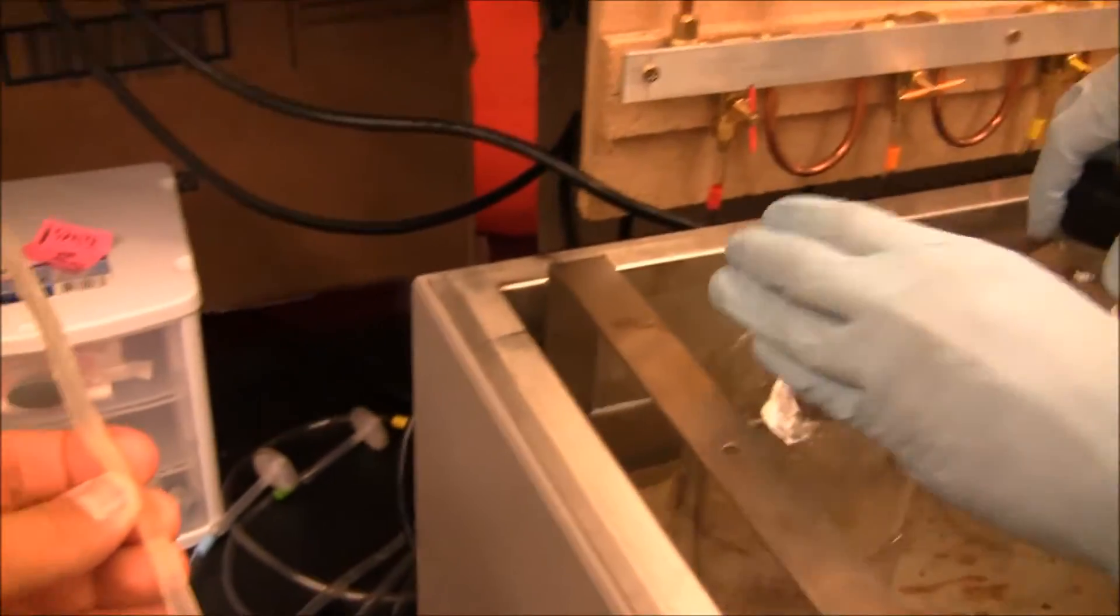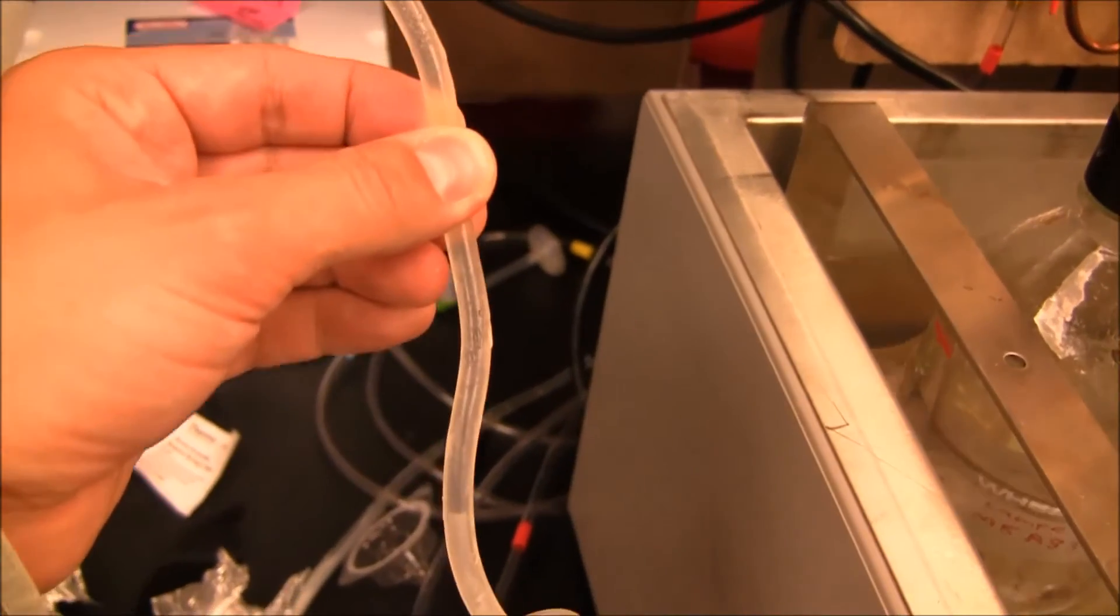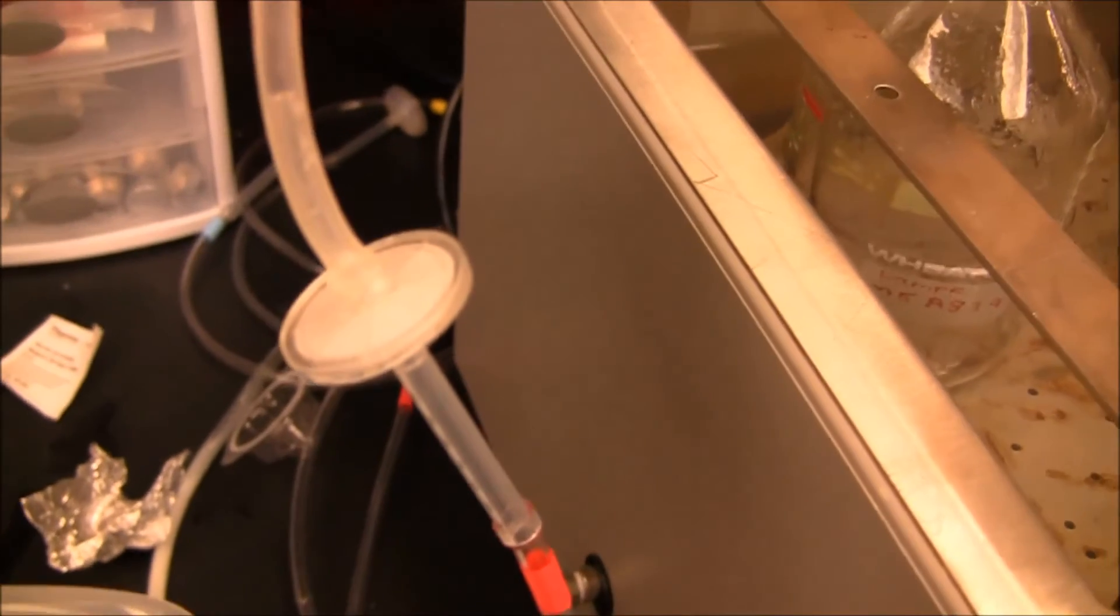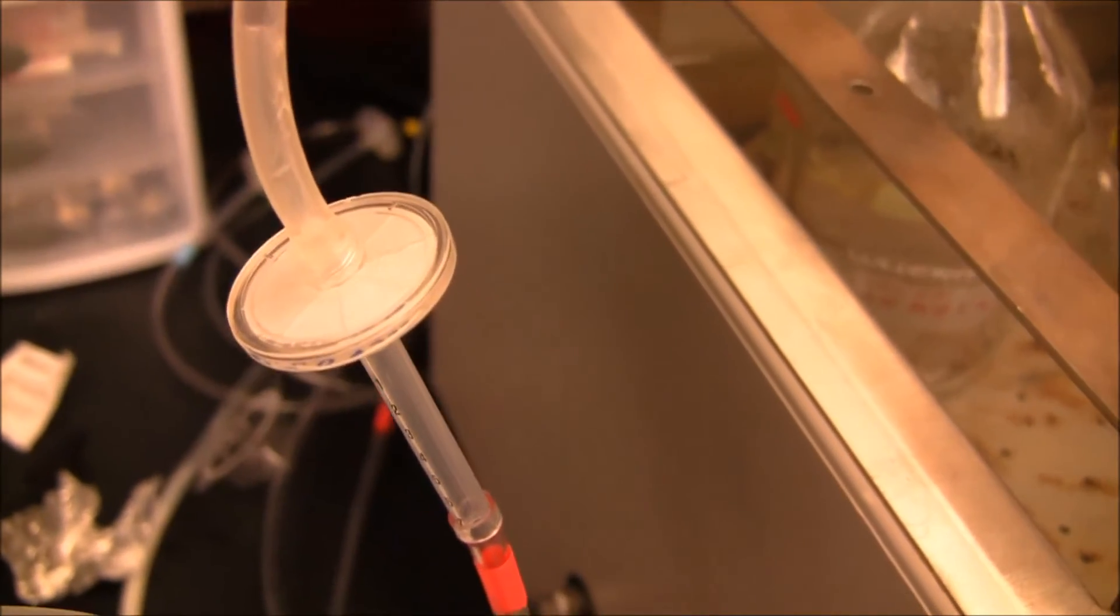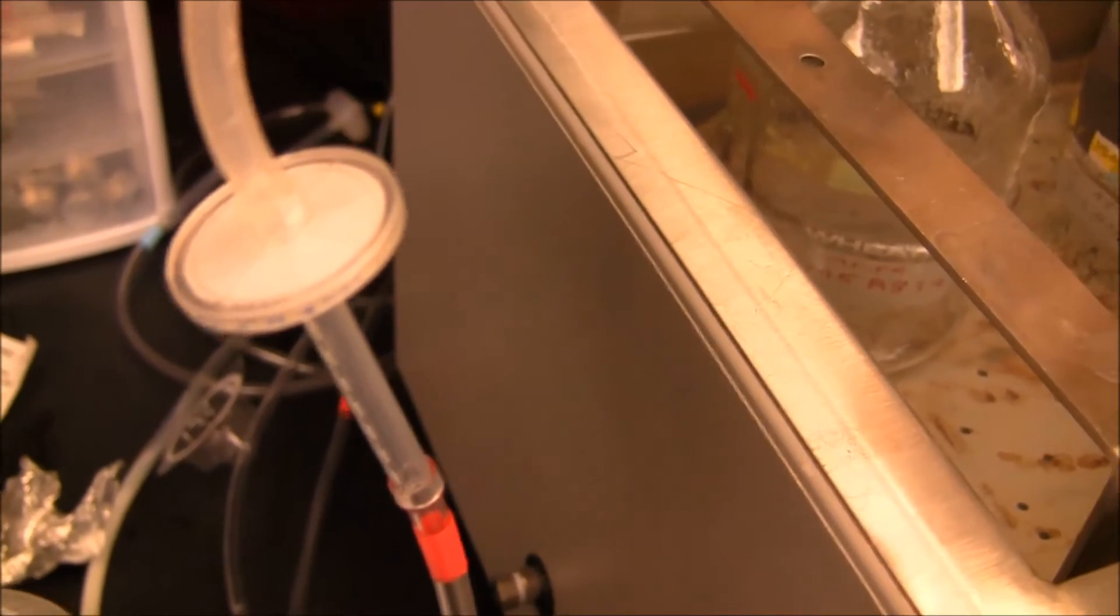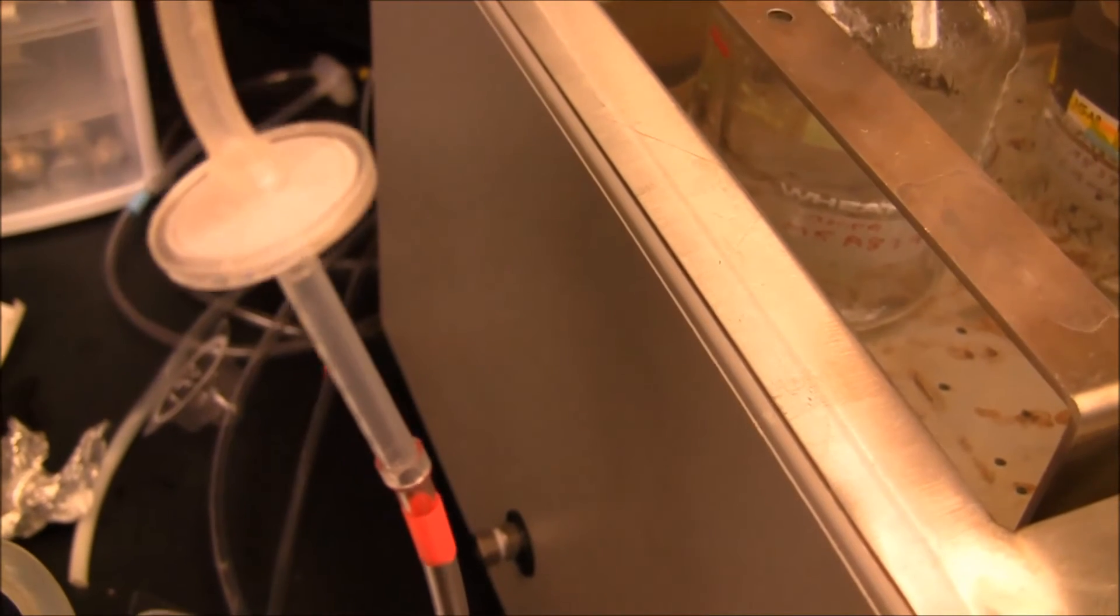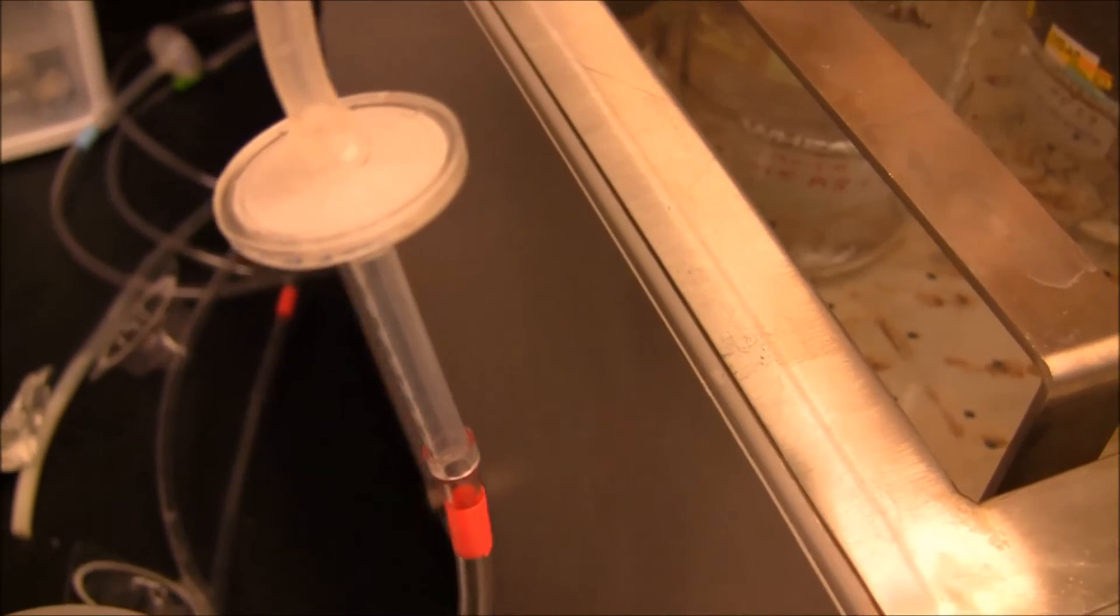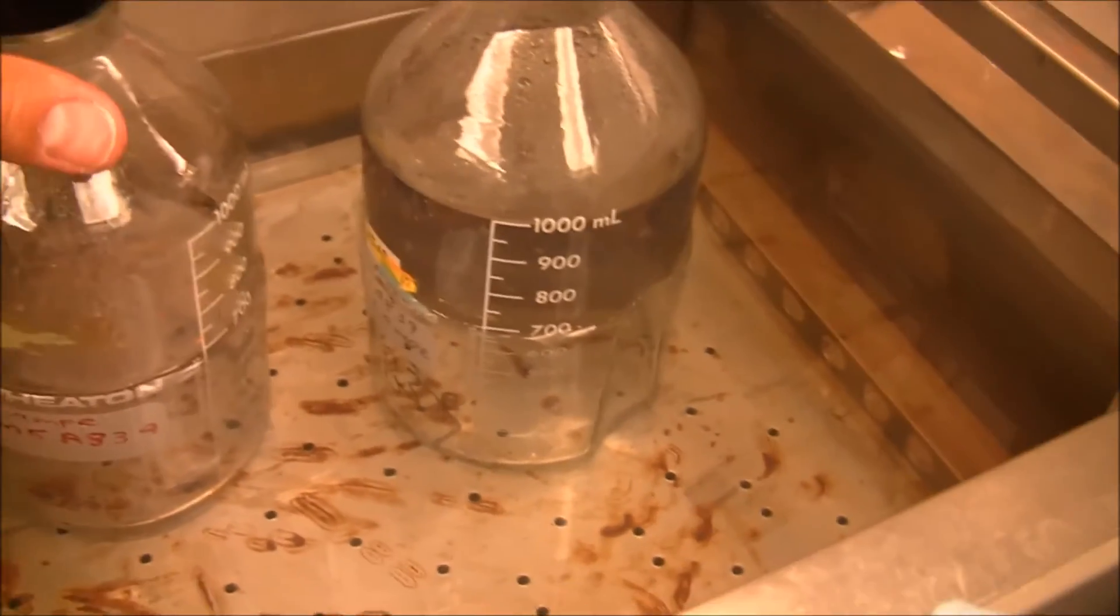I would like to also bring to your attention that you could see here, sometimes liquid goes into the gas line, because this 0.22 micrometer filter, when it gets wet, it doesn't let any gas through. And it sometimes happens at the end of bubbling, but as you see, it didn't harm any anoxic treatment.